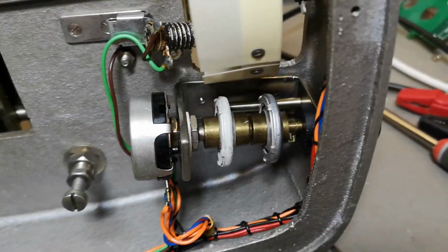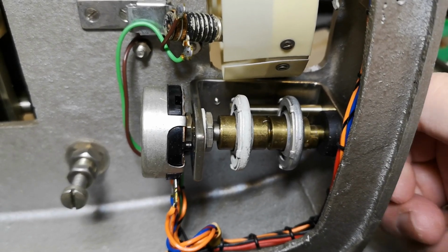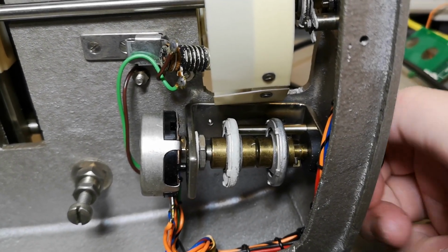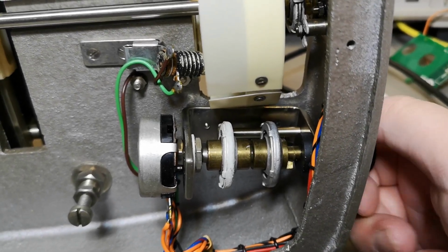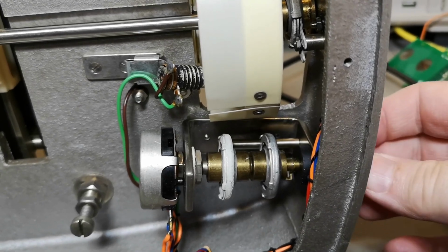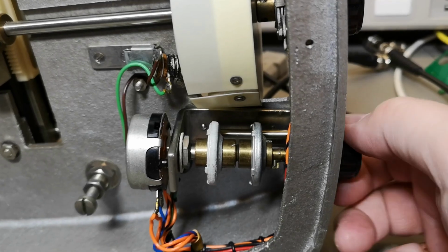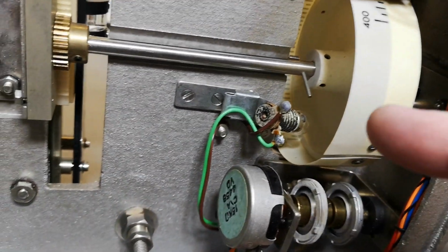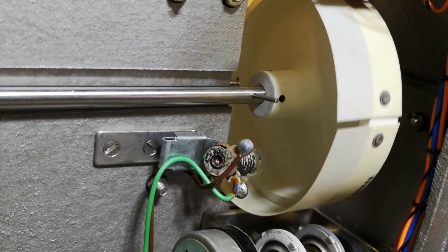What I found is this zero knob. It moves only one rotation. And look at the way the gearing here works. So it only moves the pot very, very little. But it seems like all I have to do is just go to the end and then use violence. See, now I can have another go somewhere else. And then get back again. So that is a funny way to make a multi-turn, and then the normal working range can be moved by simply just using more force. So that was pretty funny. And here's the bulb. It's a little bit funny. The bulb is not in the middle of that one, but the entire scale lights up pretty good.